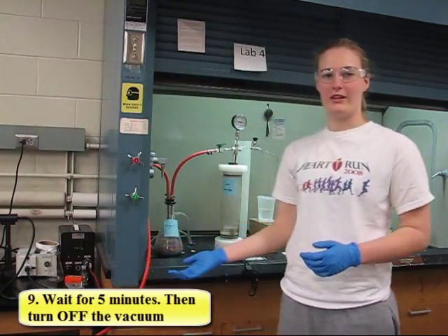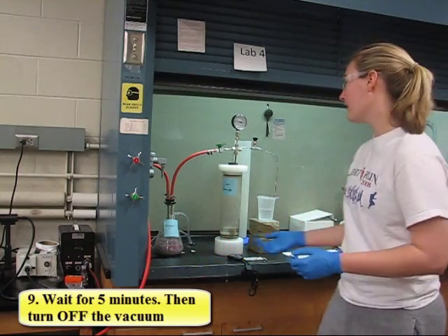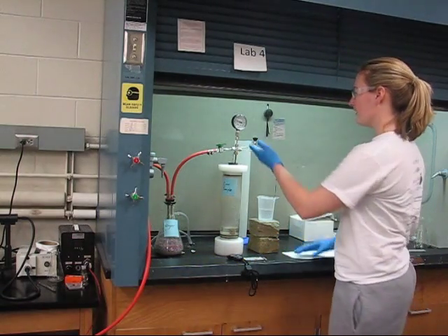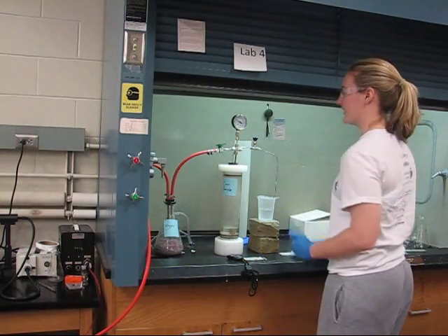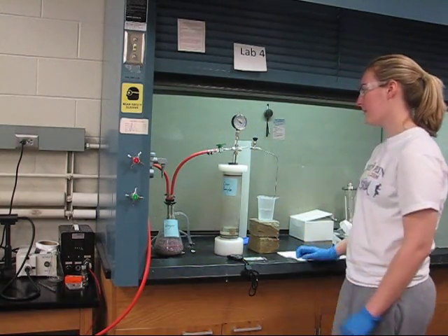Now we're going to turn the vacuum pump off and then wait for this gauge to go all the way back to zero.